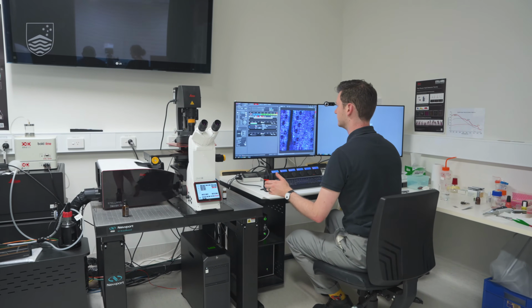I work primarily with light microscopes, such as the ones in this room. So looking at the scales from about 200 nanometers up to several microns or even a few mil. We have staff at the facility who use scanning electron microscopes and transmission electron microscopes to look at things down to the angstrom level, so incredibly small scales.